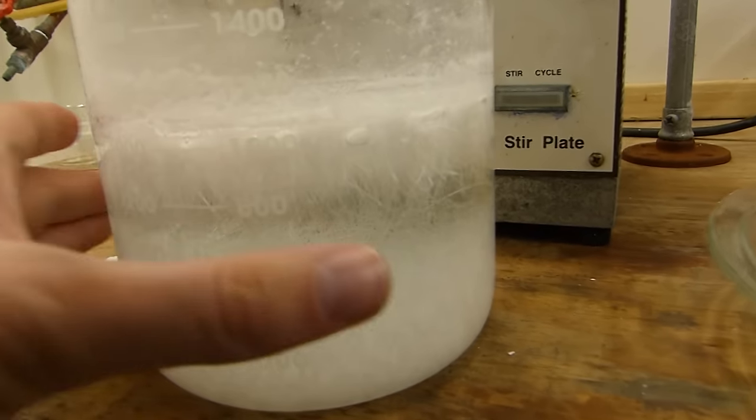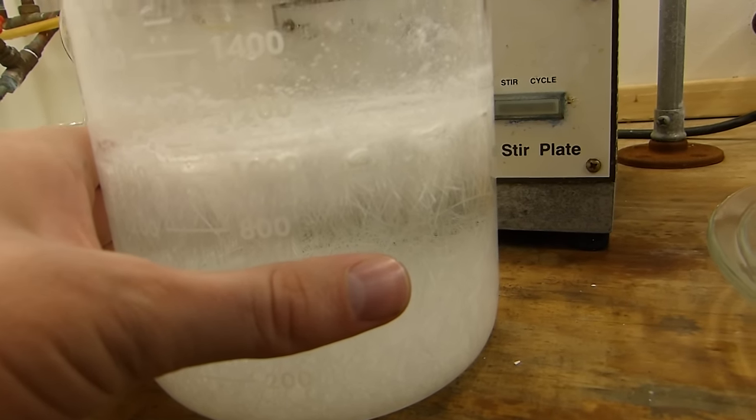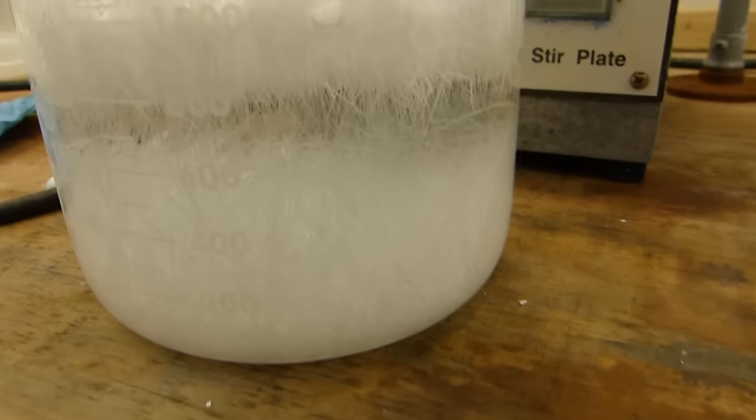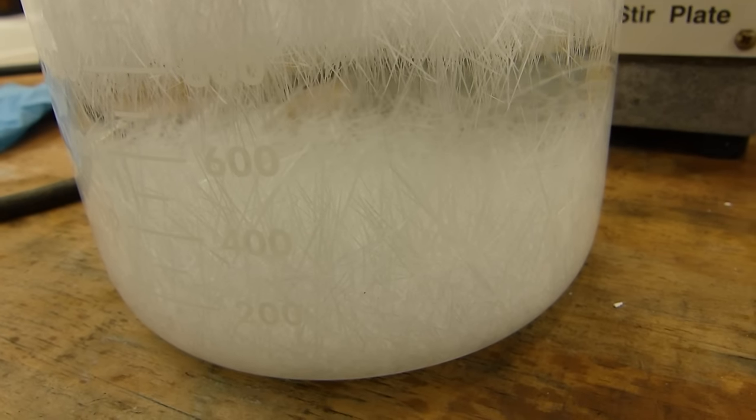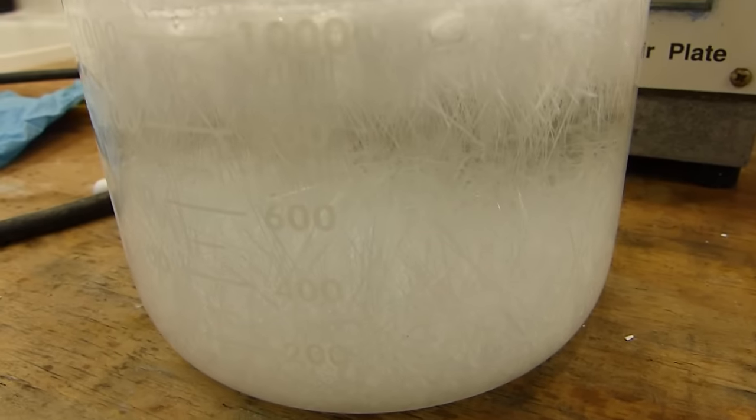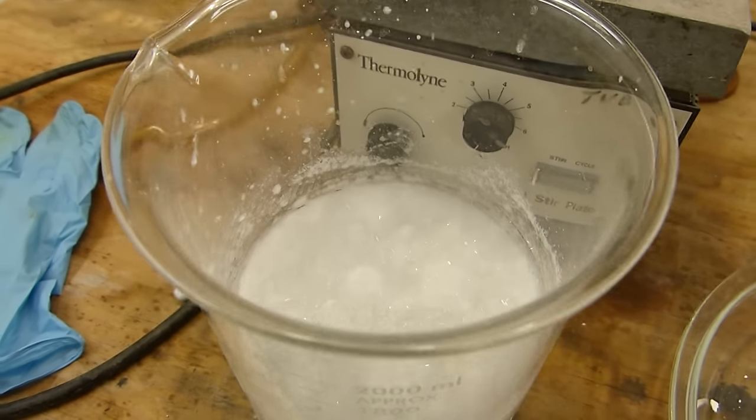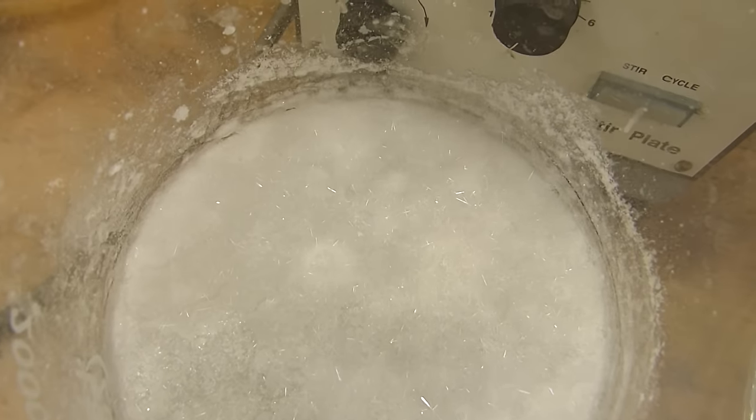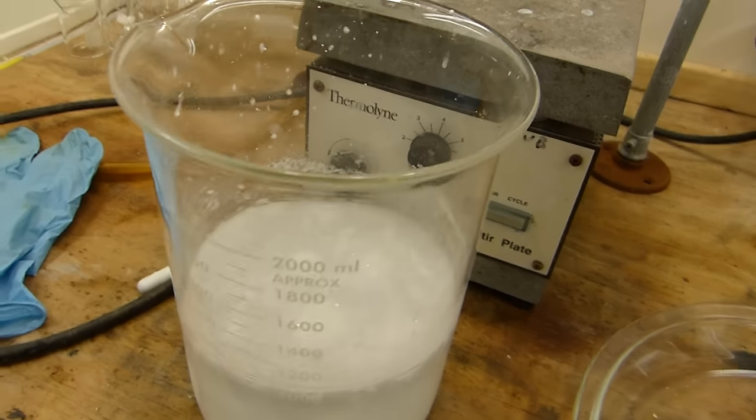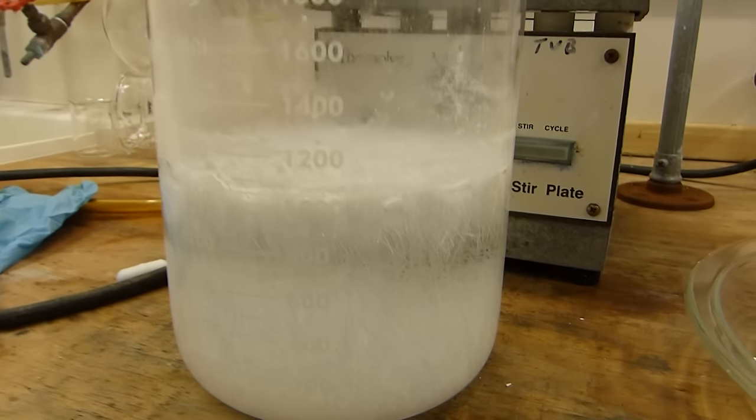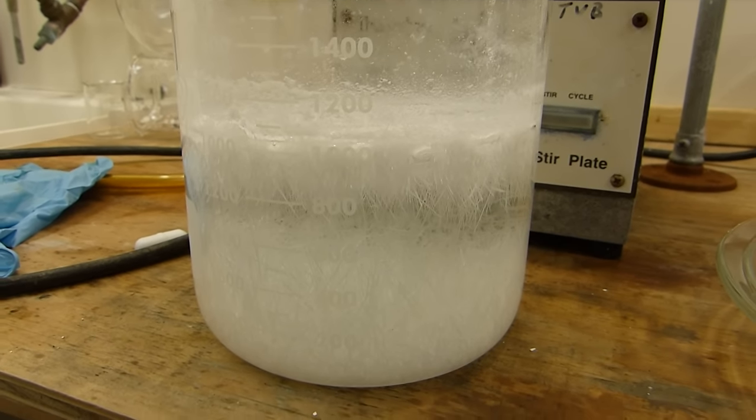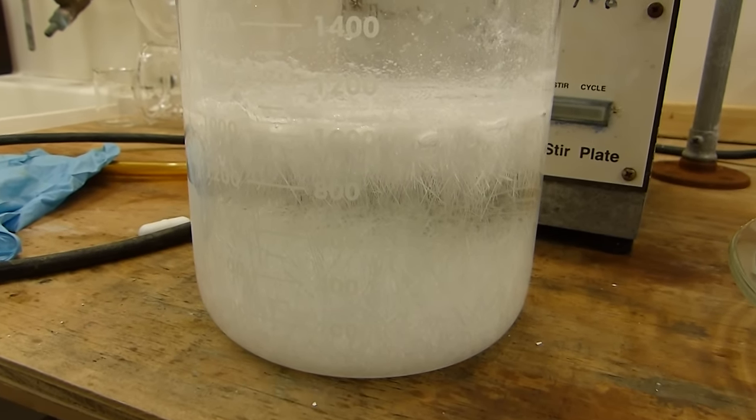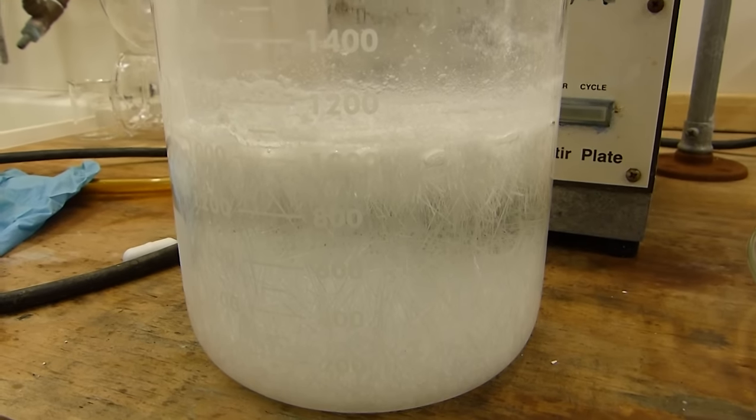That's been about 30 minutes, and this is still pretty warm, actually. And you can see the crystals are indeed forming of pure benzoic acid, and we'll be able to harvest those crystals later after this comes to a full cool. We're going to cool this of course up to room temperature, and then this will be stuck in the refrigerator, and then finally the freezer. And hopefully we can harvest the crystals at zero Celsius, which will give us the maximum yield possible.